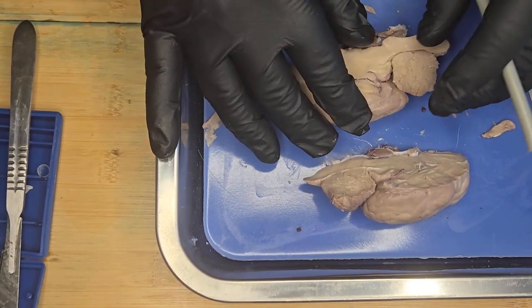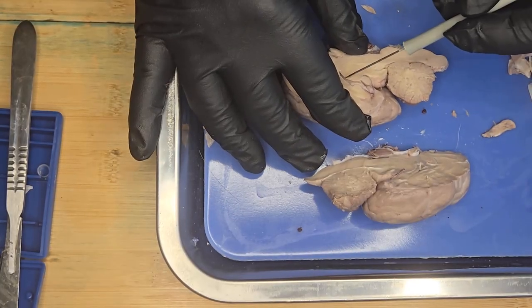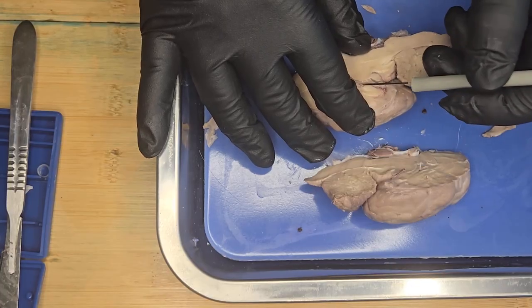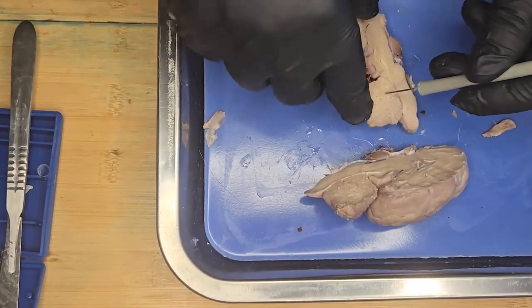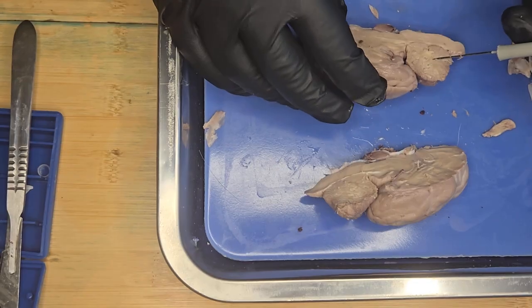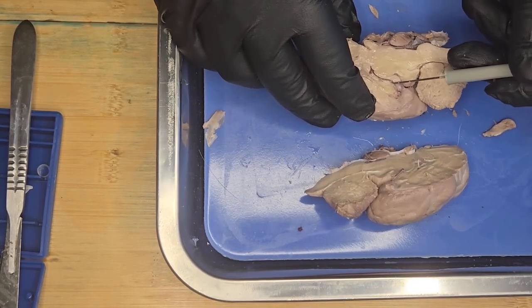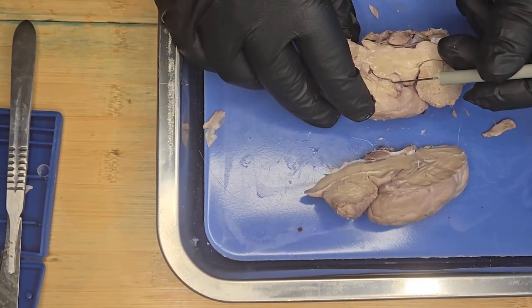Within the brain are ventricles, okay? And we have the third ventricle here. And these are cavities. And then there is the fourth ventricle, which is here. And these are a system of interconnected cavities that contain cerebrospinal fluid, or CSF. And the ventricles cushion and protect the brain and deliver nutrients and remove waste and also maintain a pressure balance.